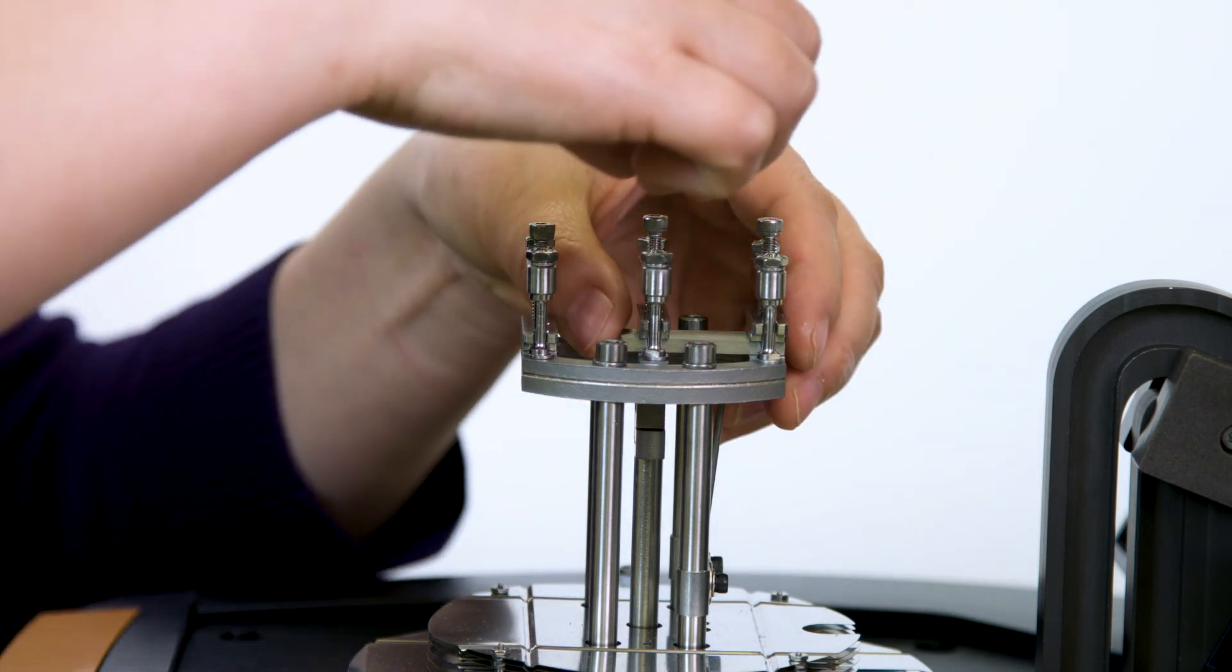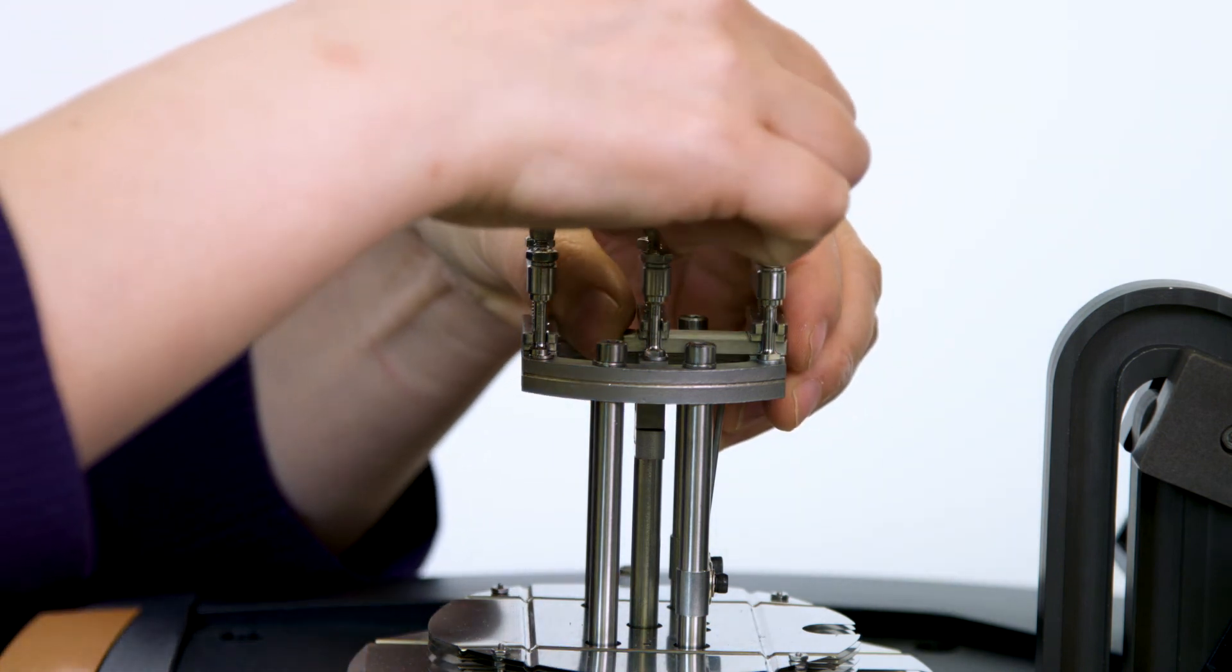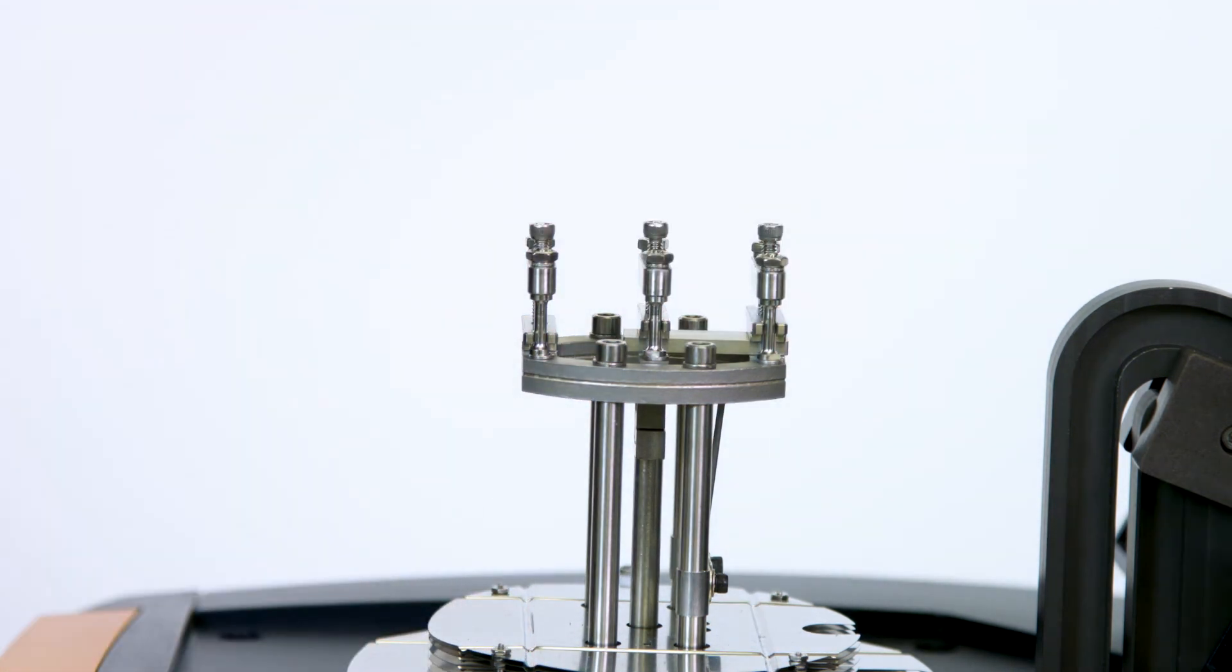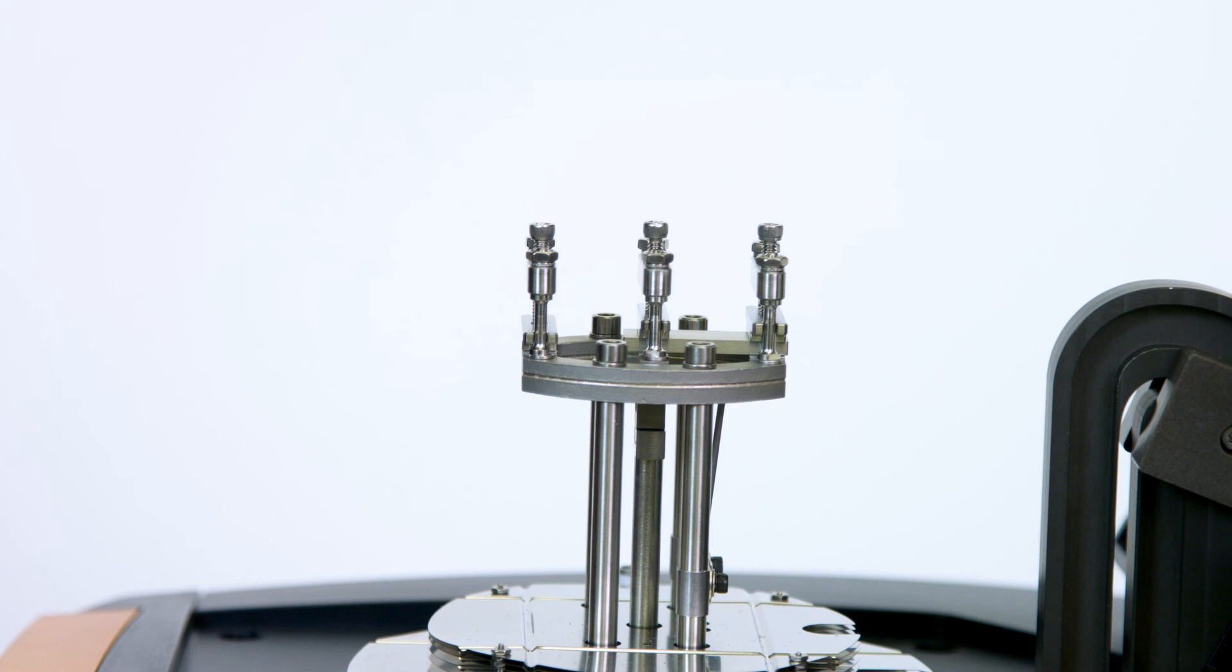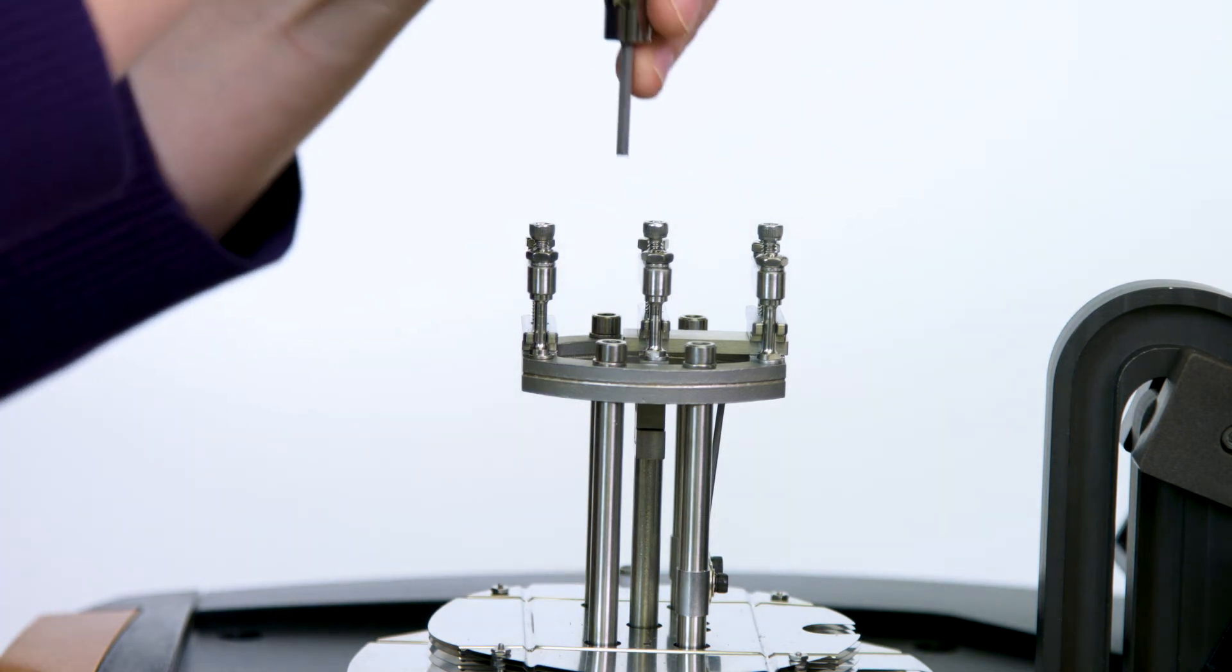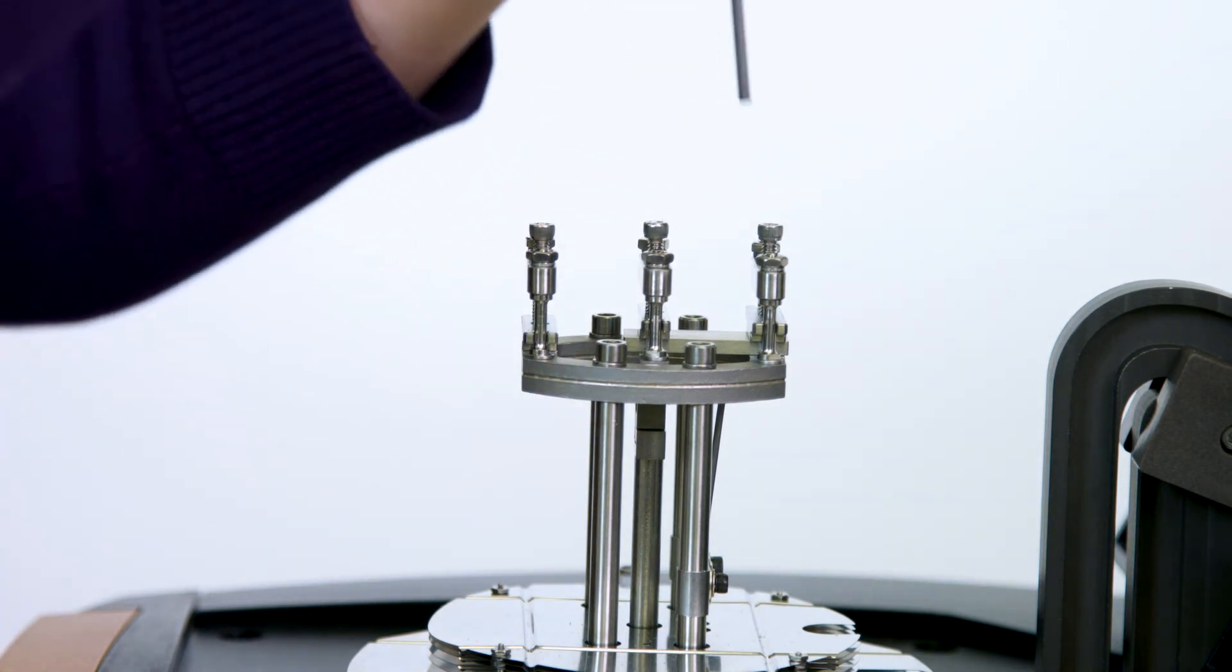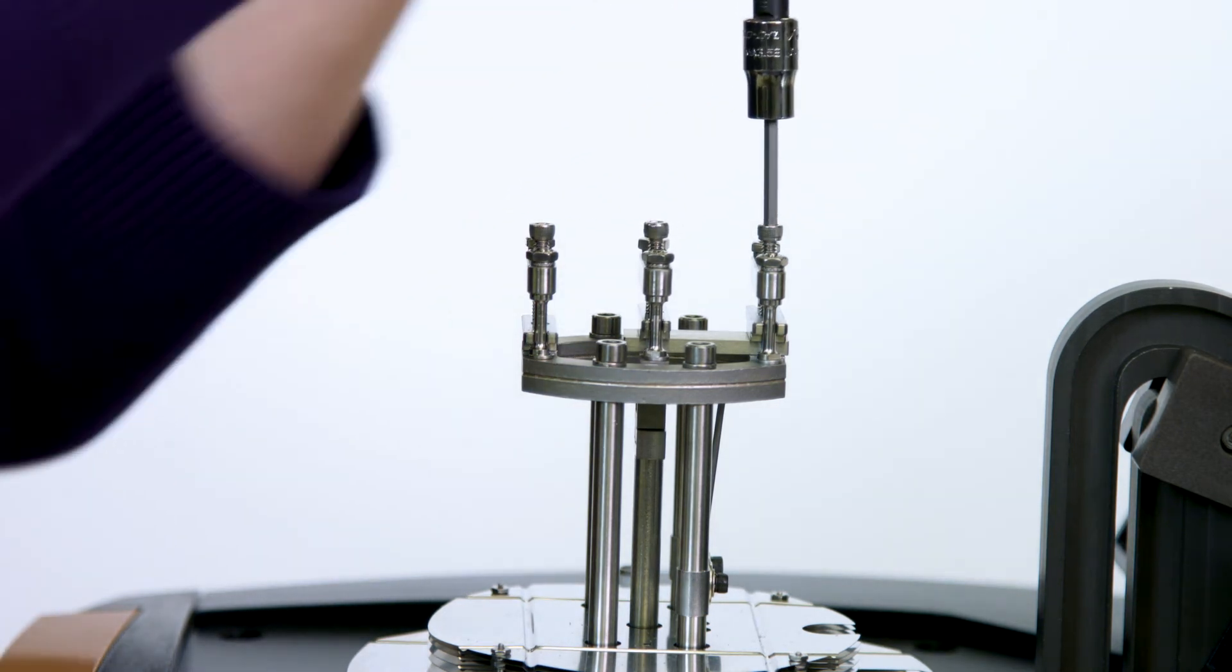Since the instrument thermocouple is located in the back of the clamp, the steel sample should be mounted from the back of the fixed clamp to the movable clamp. A single cantilever test only uses half of a dual cantilever clamp.